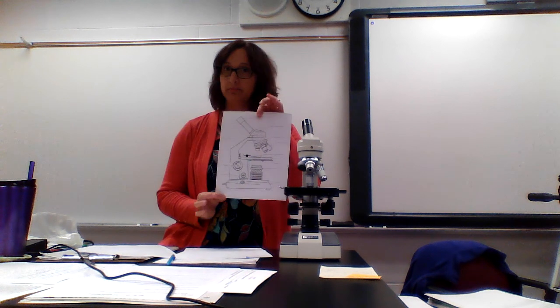All right, those are the basic microscope parts and functions. Make sure you know those. Color code, that's great. And then I'm also going to include a video soon on some other facts about the microscope and how to make a wet mount slide. So we're all ready to go with that.